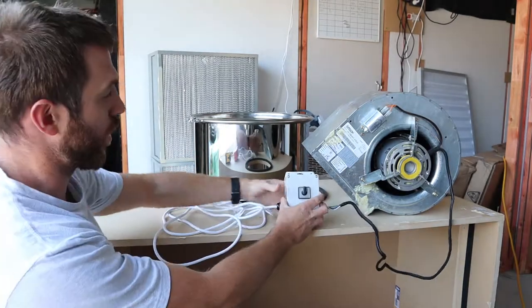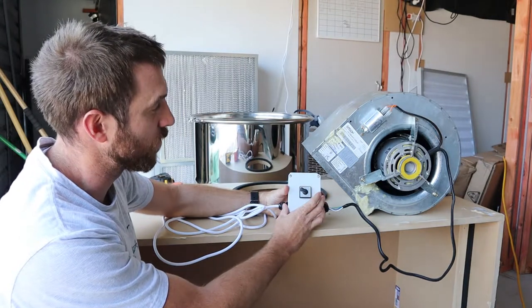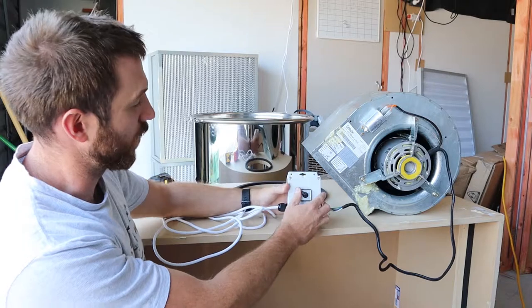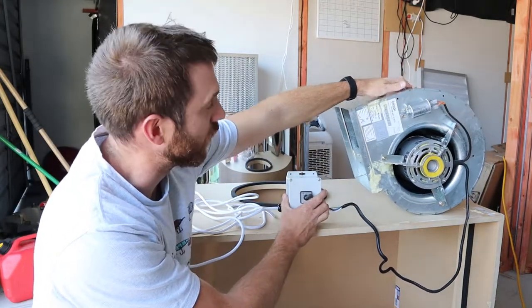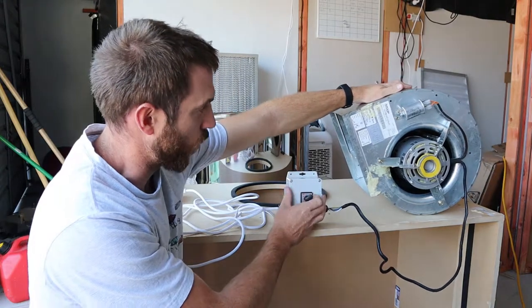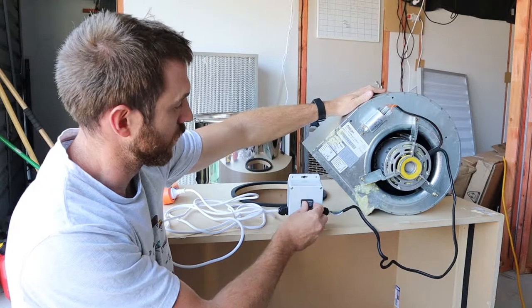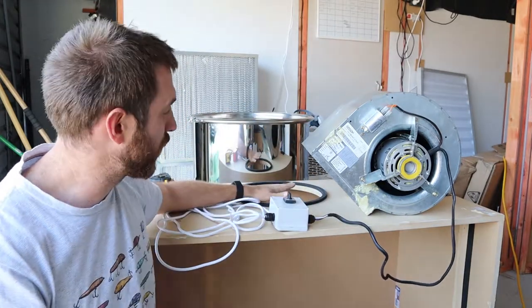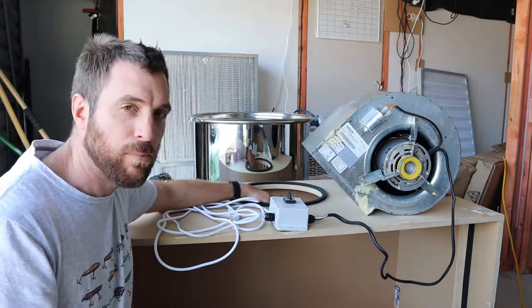Obviously I just wired it in. This box here, if we turn it to 1, that's its low speed. Feel it coming out, and then if you turn it to 2, it actually wants to blow itself over. So it's quite a bit of air coming out of that there. That will be mounted on the top, blowing down. I've seen people mount them underneath, blowing up, but I'm going to mount one on the top, blowing down.